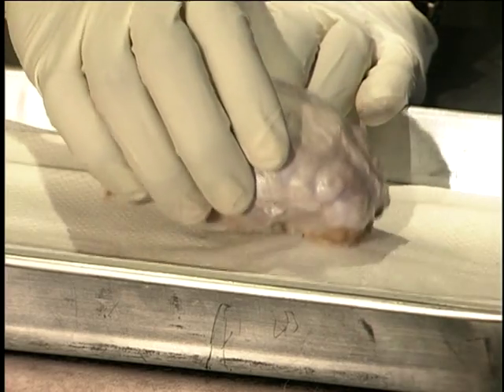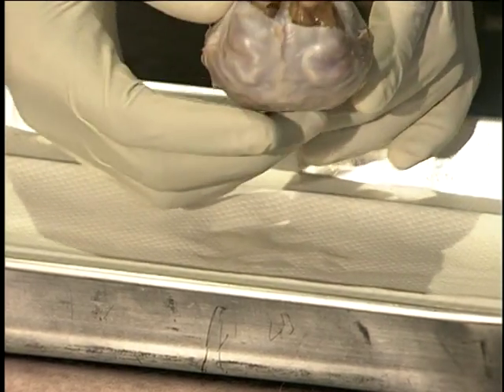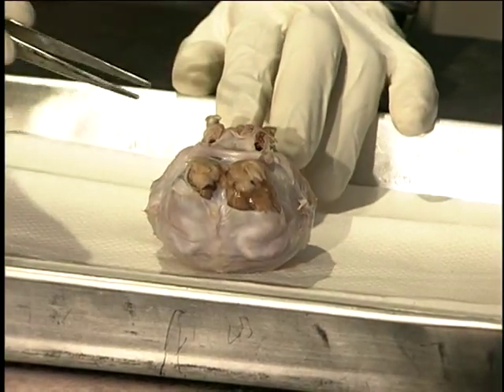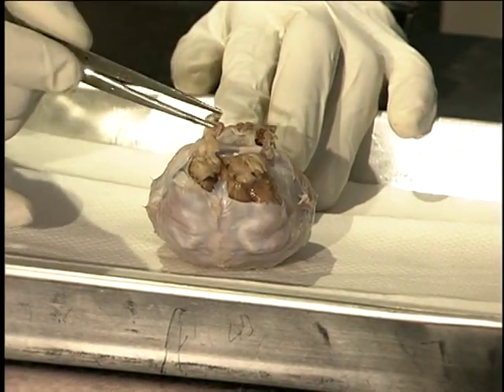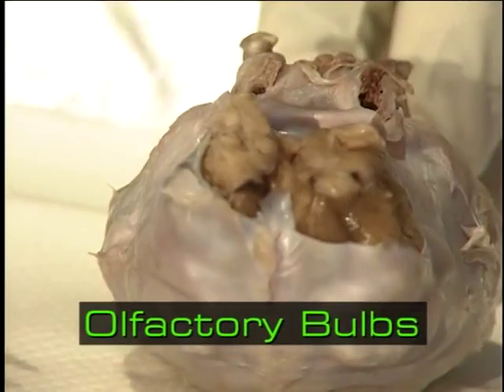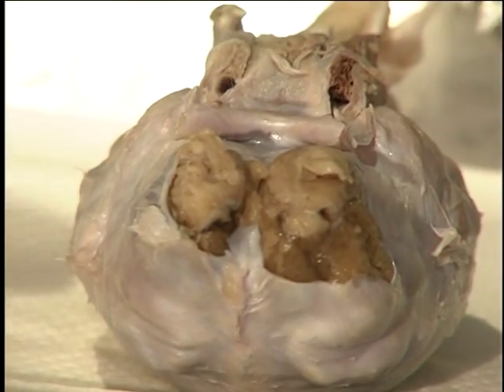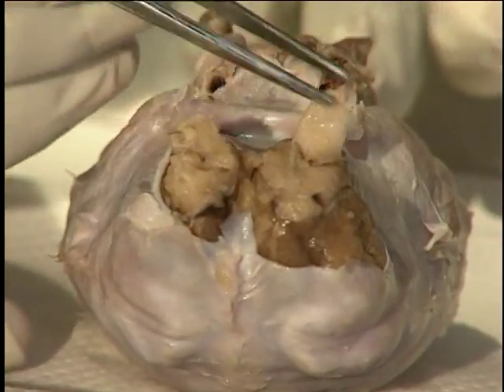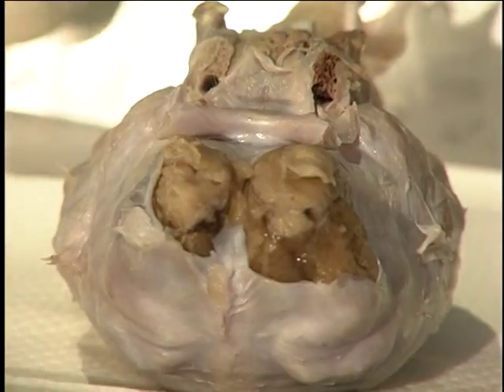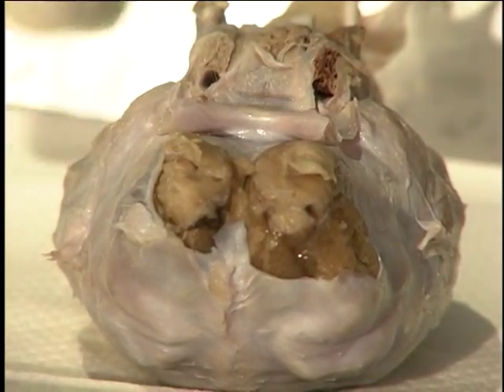As we turn the brain over, we'll notice that the parts of the brain look much different on the bottom than they do at the top. Towards the bottom of the brain, we have what is known as the olfactory bulbs. And the word olfactory means your sense of smell. So this is the part of your brain that picks up the smells from the air around us and lets us know what we're smelling, like, say, chocolate chip cookies or pizza or chicken.